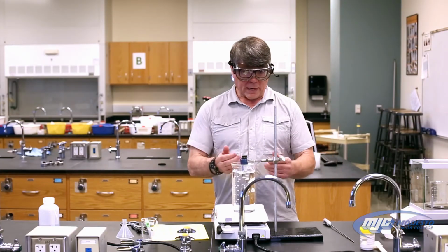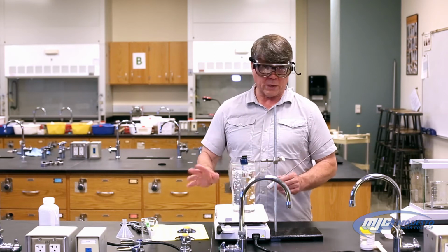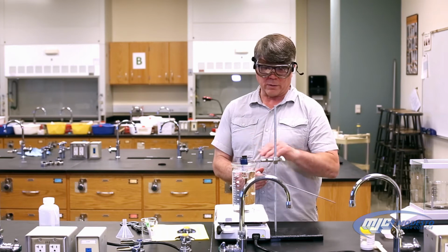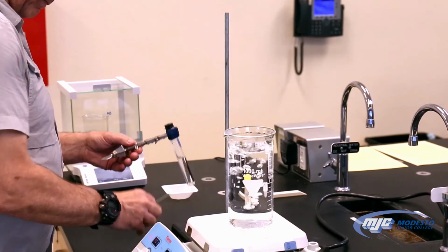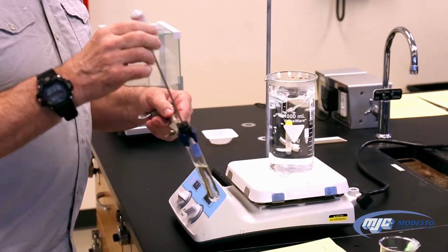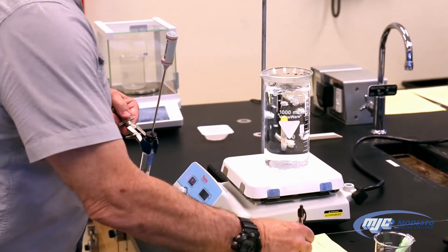All right, guys, so now that the lauric acid has all melted, we're going to start recording our temperatures every 10 seconds as it freezes. Now, to take it out, this is really hot over here, so we're just going to lift it up over here. This is not hot. I'm going to take my thermometer, use the digital thermometer, place it in here, and just keep on shaking it and recording the temperature every 10 seconds.